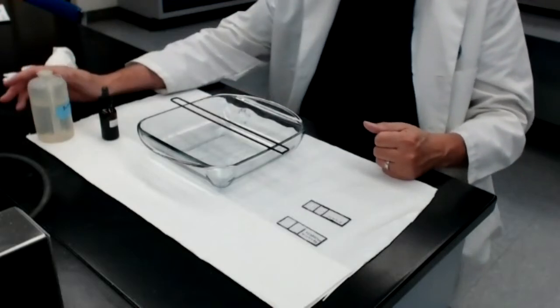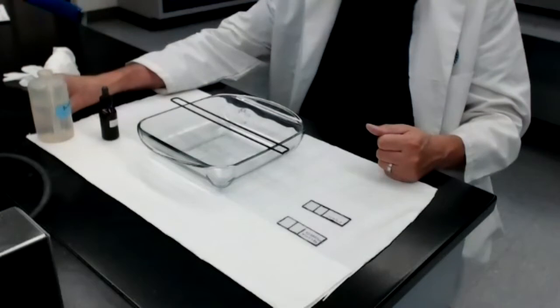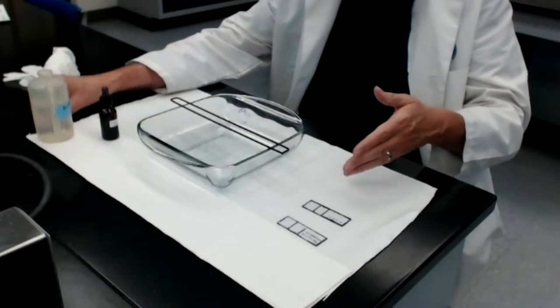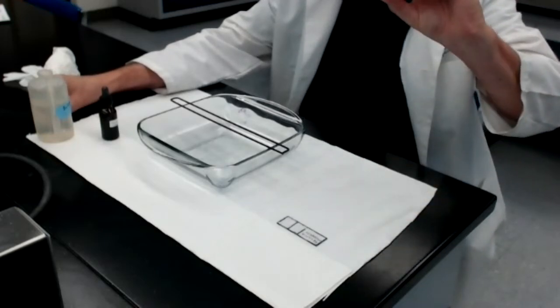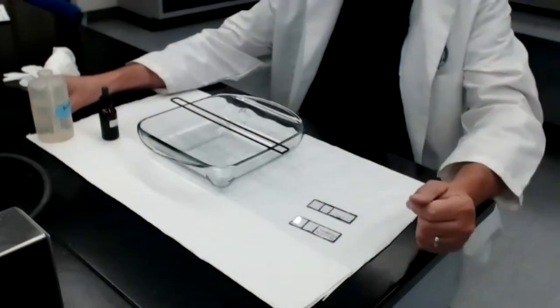Now, whenever you do a bacterial stain of the sort that we're doing here in modules 5, 6, 7, and 8, you need to start with a properly prepared bacterial smear. I showed you how to do a bacterial smear in the video that goes along with module 4. So I made the decision to prepare the bacterial smears for today's lab prior to turning on the video camera. So these two slides, this is E. coli, this is a smear of Kocuria rhizophila. These two slides have smears that have already been prepared. They've been air dried and heat fixed and they're ready to go.